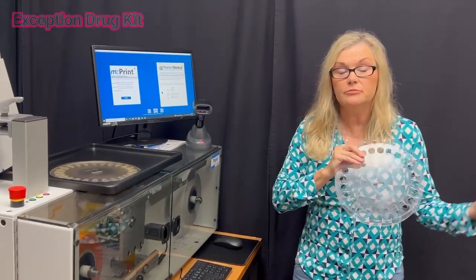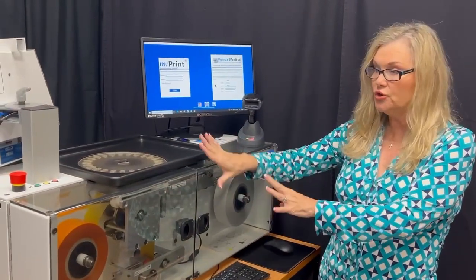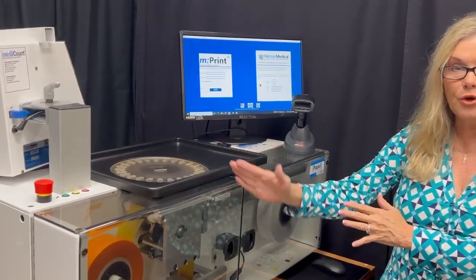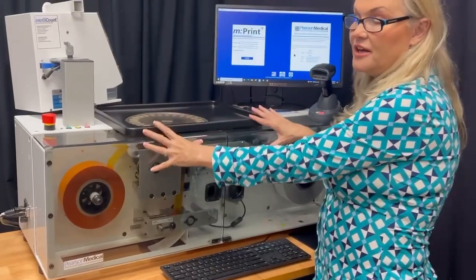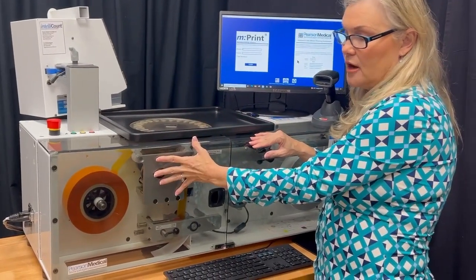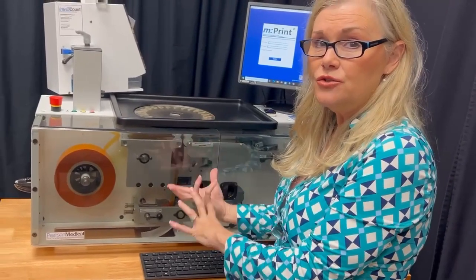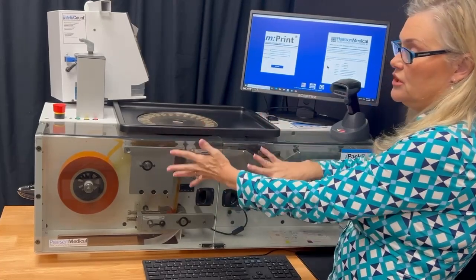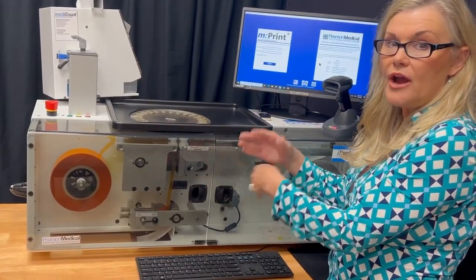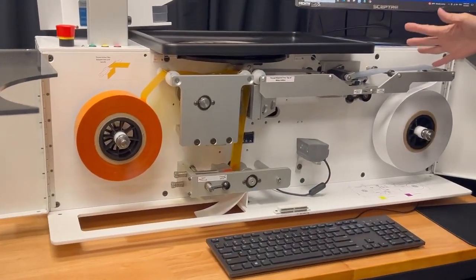Those additional kit pieces can be sanitized while you are packaging one of your drugs. We're going to come closer and I'm going to show you where the pill falls — the pill path — and then later we'll do a drug run. Notice that all of the packaging is concealed behind these plexiglass doors. That's done to make sure you have access to the packaging material, access to the mechanisms for packaging, and the ability to clean those. It's also done for safety to keep all of that out of the exposure of the worker.